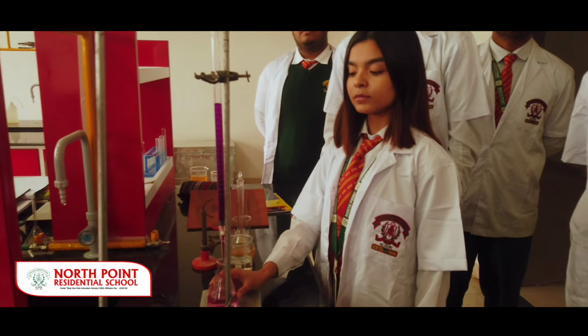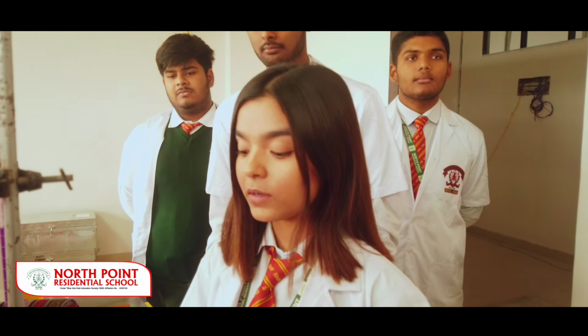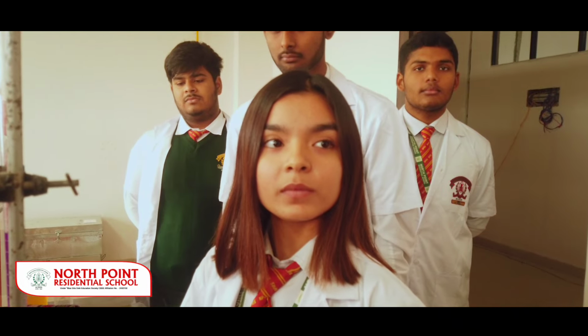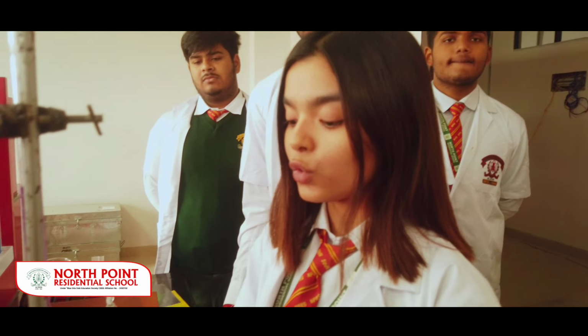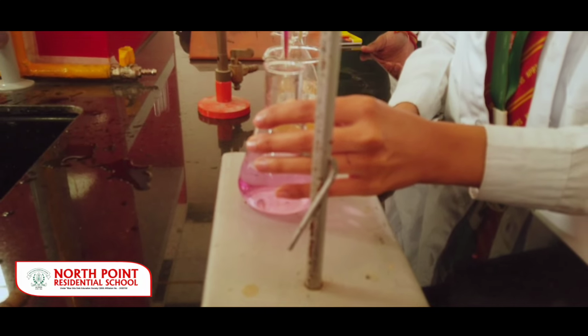Okay, so guys, hello everyone. How are you doing today? Yes, so we are all doing fine today, and we are all feeling very excited for the chemistry practical examination, which we are practicing right now. So talking about my experiment, we are performing titration right now. So giving a brief gist about the practical.